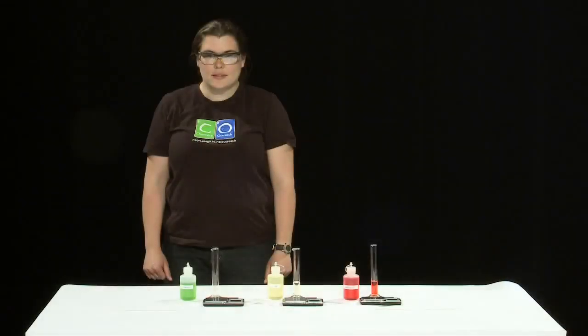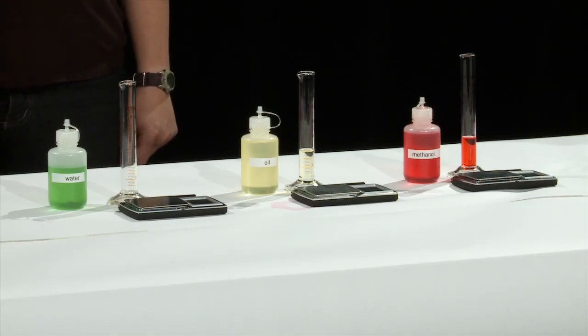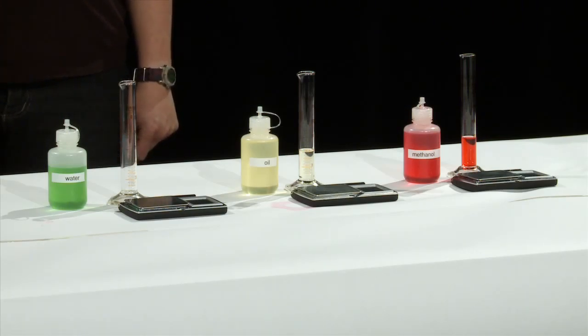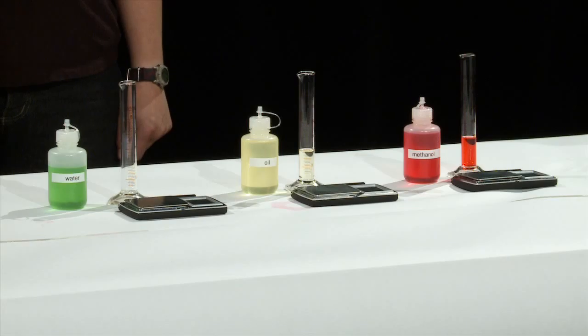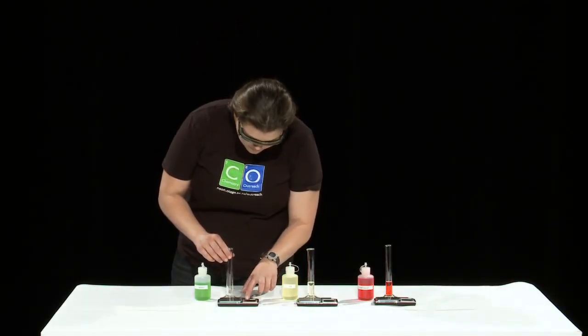For this experiment we're going to measure out 10 milliliters of each liquid and weigh how much that is on a balance. Now Trudy has already measured out 10 milliliters of oil and methanol. Now let's see her do the experiment with water. Firstly, place the empty cylinder on the balance.